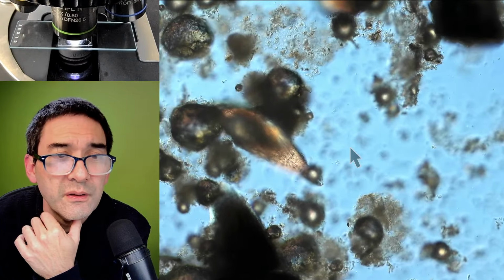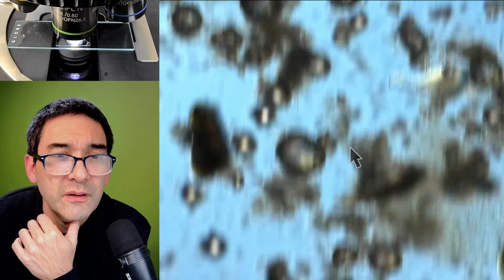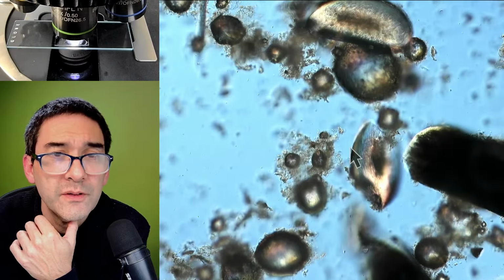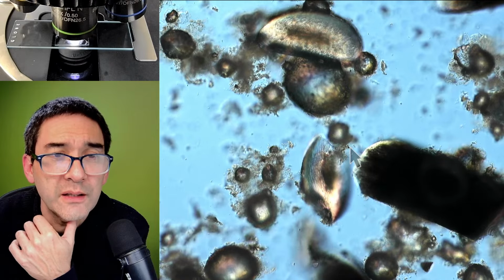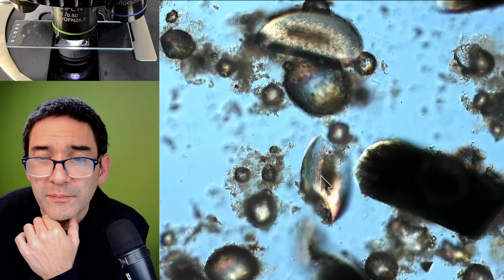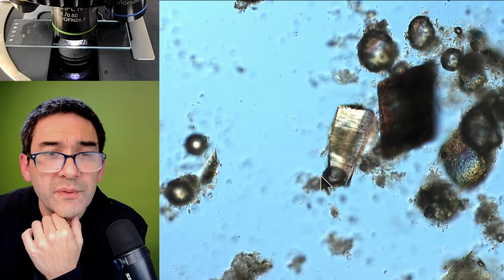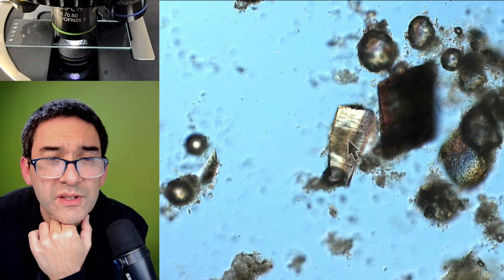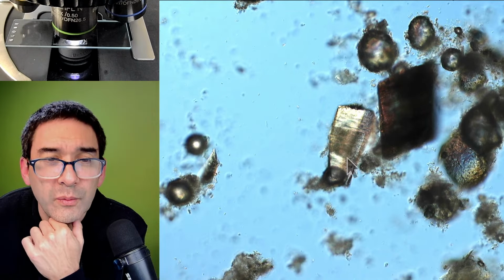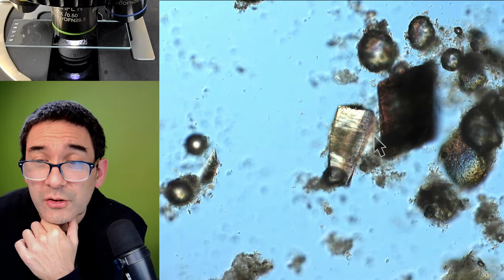Where else here? Yeah, there's so much. You see, there's so much other junk in here. Skin cells and soap and so on. I don't know if this is the one. Yeah, here that's again. These were again the two that we looked at. The cross sections here, with the central canal. Oh yeah, here again from the side view, the hair, right? And you see also here the central canal. So you see that this is actually one of the hairs of my beard, which is white, and this is still one which is black. A pretty huge difference in pigmentation.